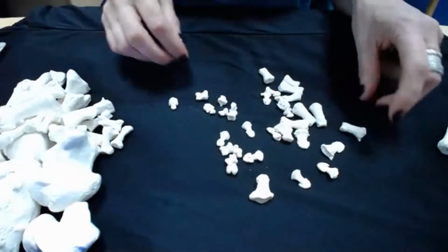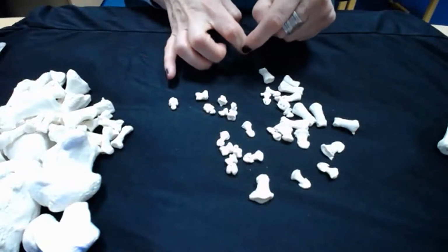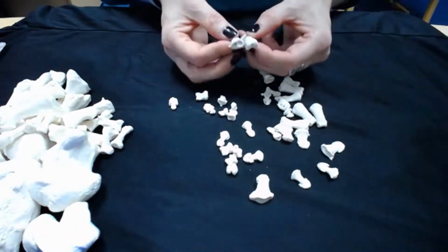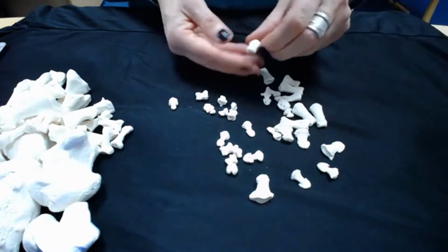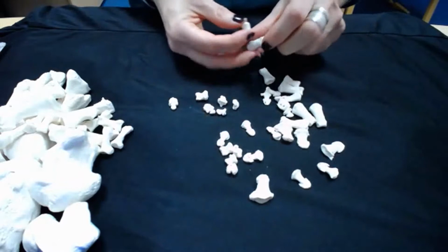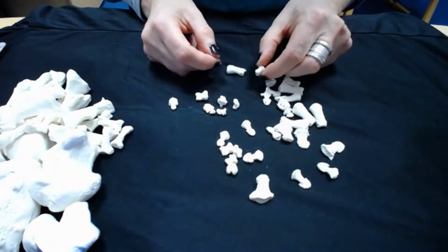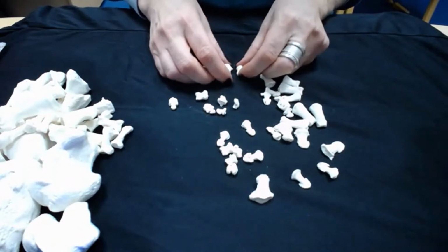Right, then the next thing to do is look for the intermediate phalanges, which are this bit between these two knuckles here. These have a double base because the heads of the proximal phalanges that they articulate with also have a double base. Okay, so you're looking for the double based ones now. And again, these are very distinctive for the hand. They're rectangles again, flat bottom almost. Whereas for the foot, they practically look like little pebbles. So they often don't get excavated, teeny tiny ones, but these are still legitimate bones for the foot.